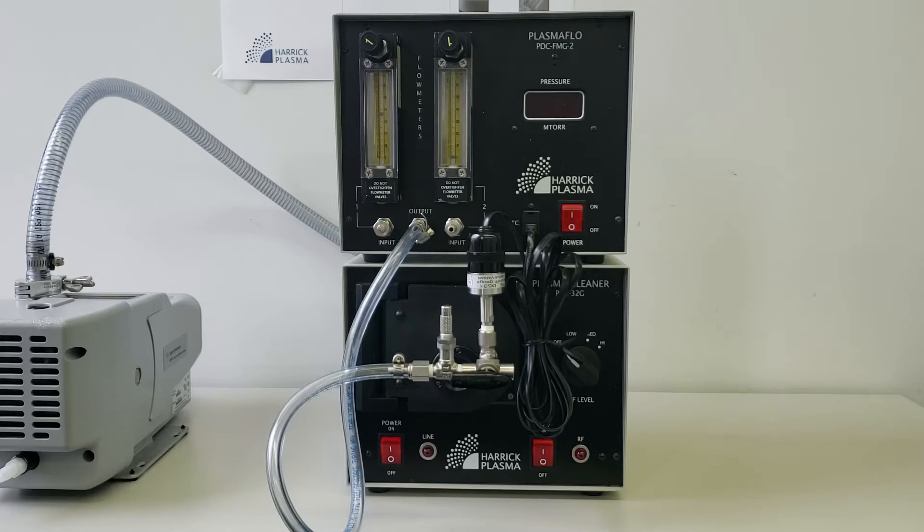If you plan to use oxygen from a cylinder, please ensure that your vacuum pump is compatible. We will use air plasma, but oxygen from a cylinder could be easily added to this system.